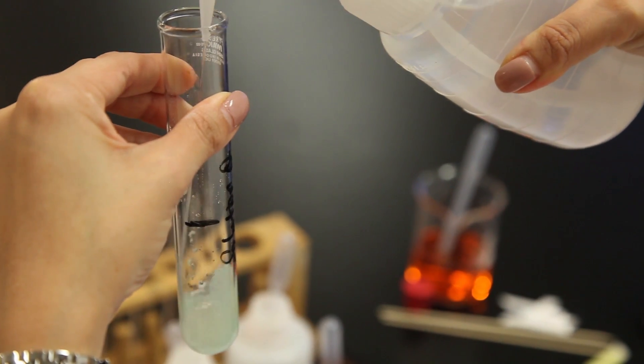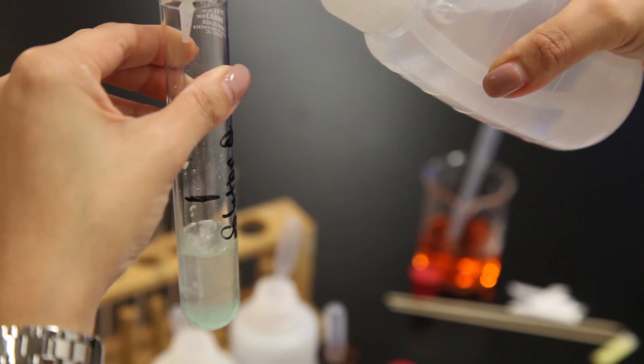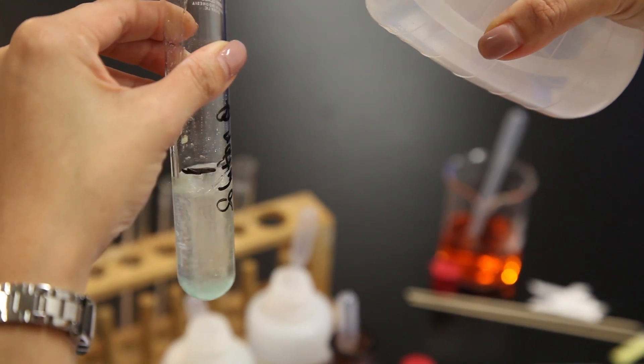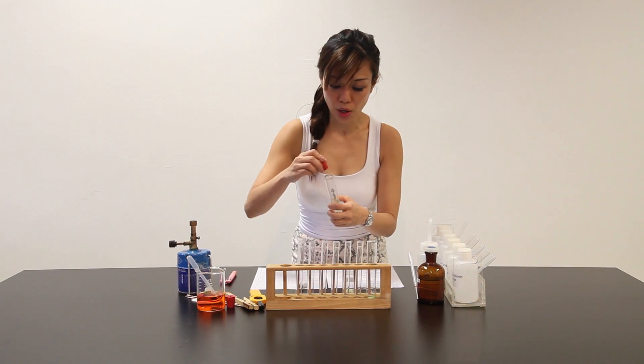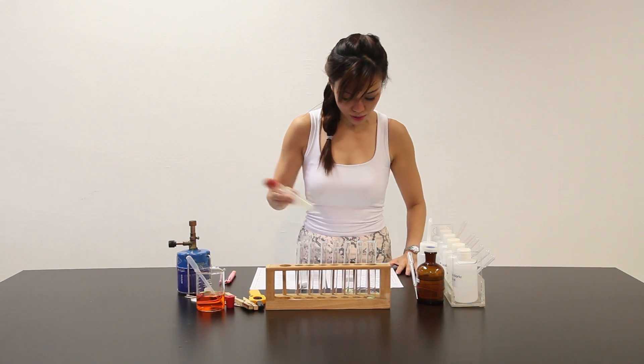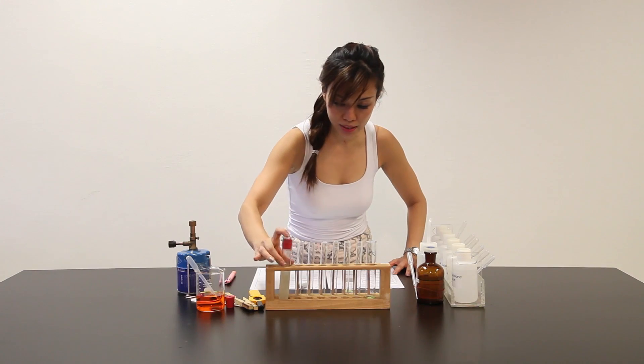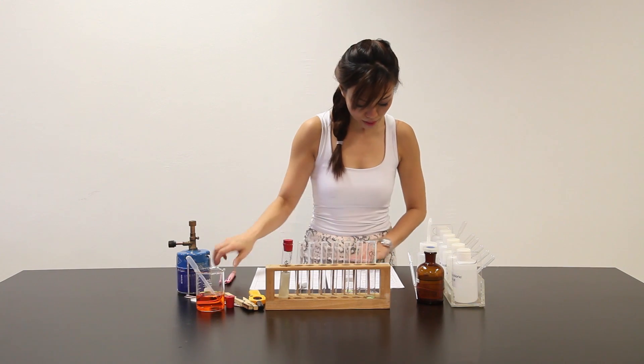Distilled water. Half test tube fill. Stopper it and make it into a solution until all the solid has dissolved. So let me put it here. I'm almost prepared for this one here.